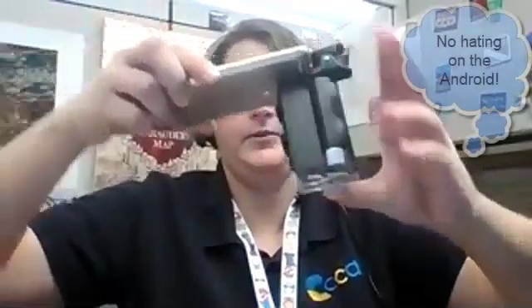It's about the size of the palm of your hand. So what you have here is this clip up top here clips onto your cell phone's camera.